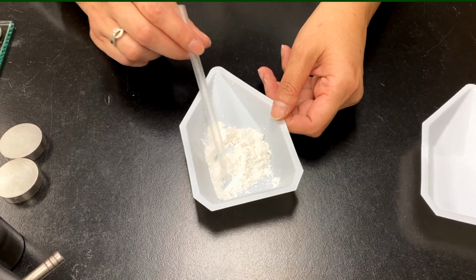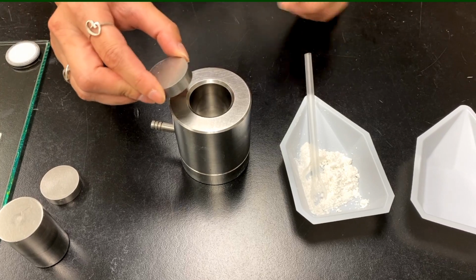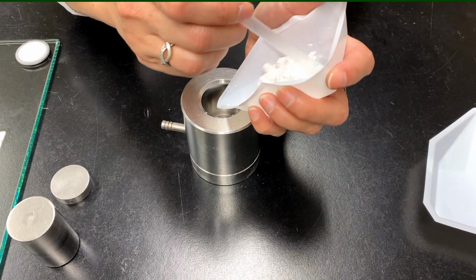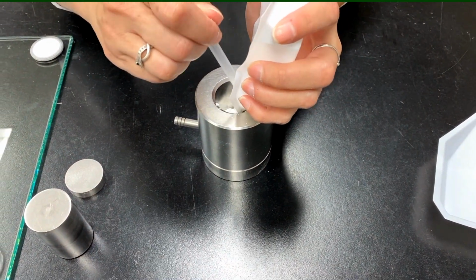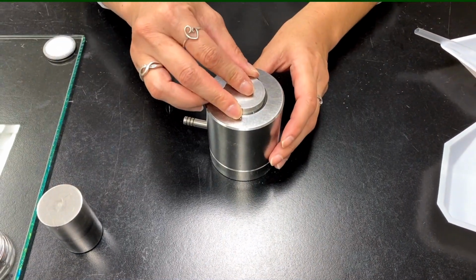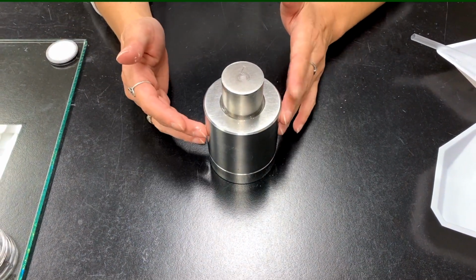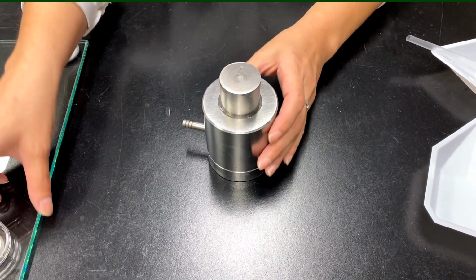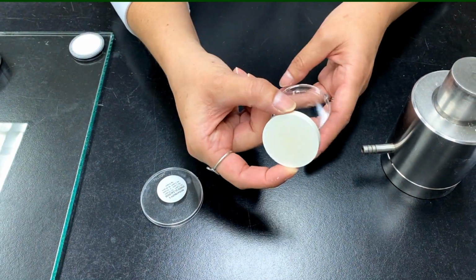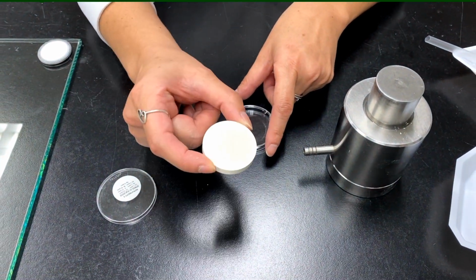All right, and to make the pressed pellet, we would use a die assembly similar to this. You would assemble it, put one of the dies in, pour all the powder in, then sandwich it with the other die assembly, and once that goes down, you would press it in either an automatic or a manual press. Once that is pressed, it will look something similar to this. Now this is a traditional pellet that you could just analyze directly on our XRF instrument.